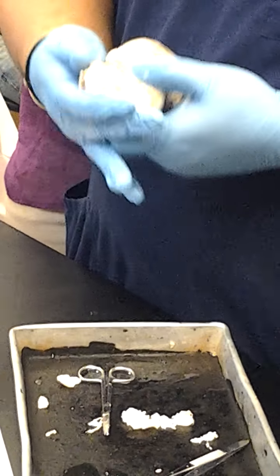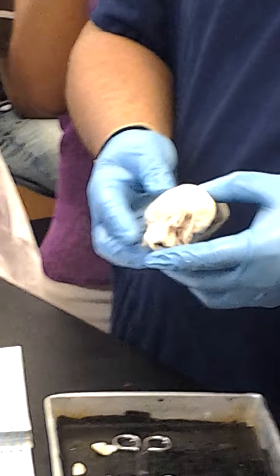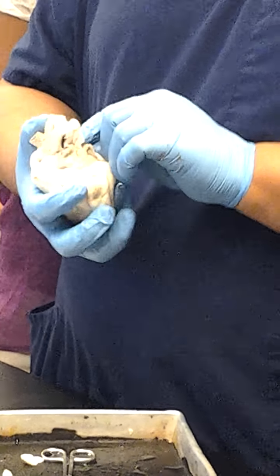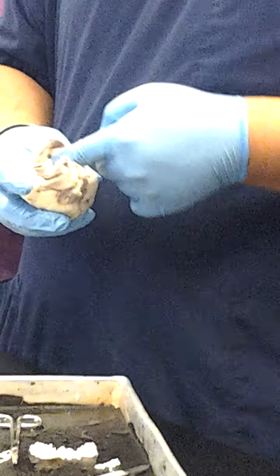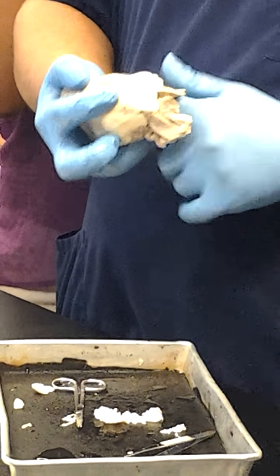Now, on here, this is a little bit trickier because you have a little bit of fat on the heart, and so what you have to start looking for are the lines, and or try to clear away the fat so that you can see a little bit better. Now, if that doesn't work, you can take your finger and go back into the auricle and then find where the ventricle is and where it ends.